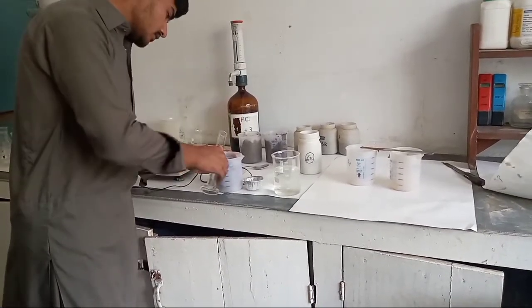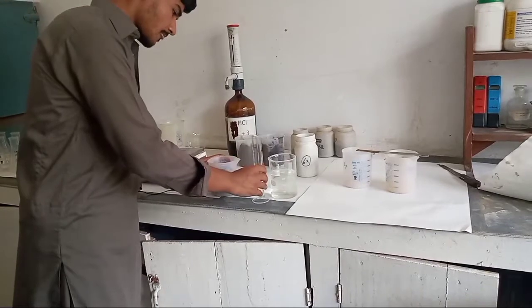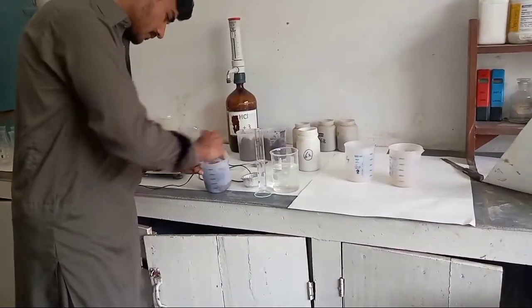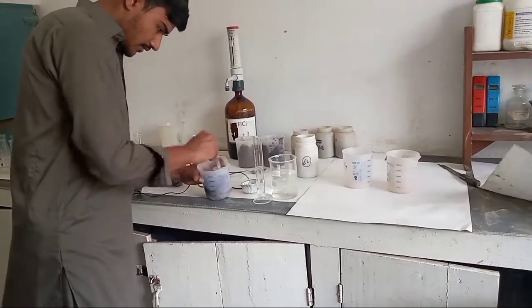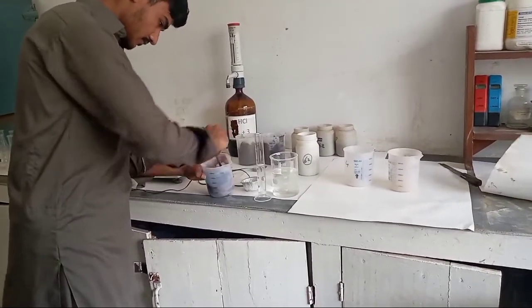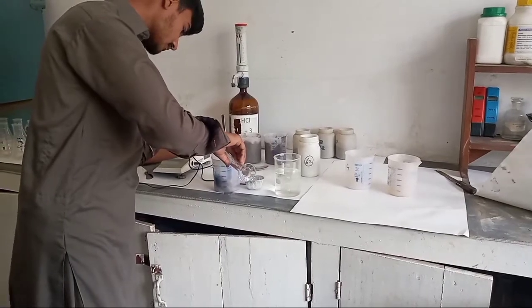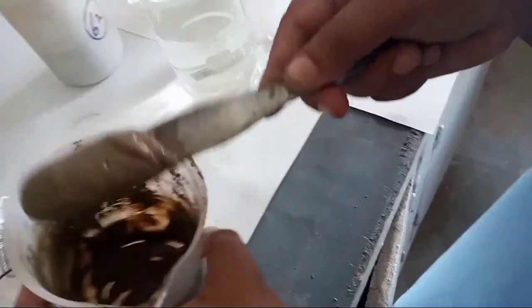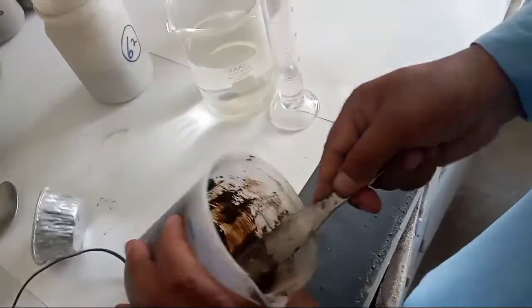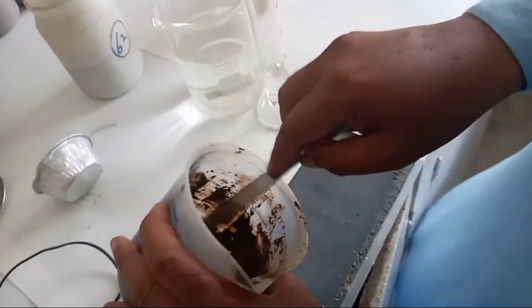Firstly we add up to 20 ml on the paper. Now you see that our soil saturated paste is now fully prepared — it is not too much sticky, and also gives shine. So our soil saturated paste is now fully prepared.